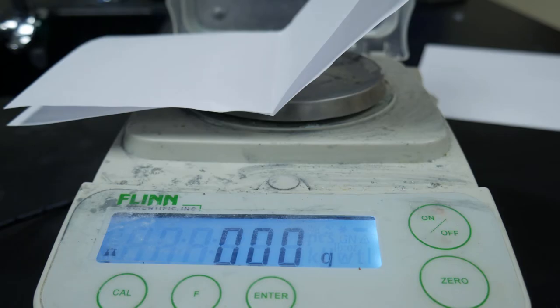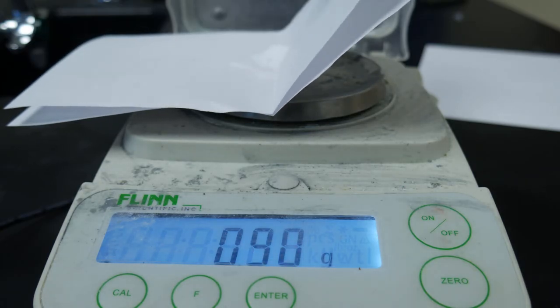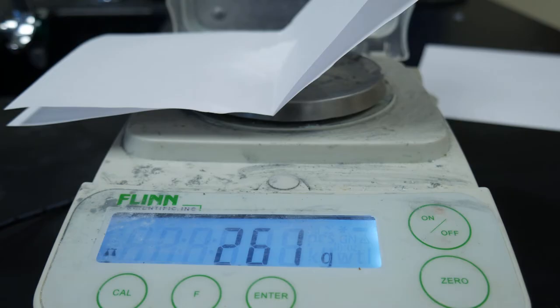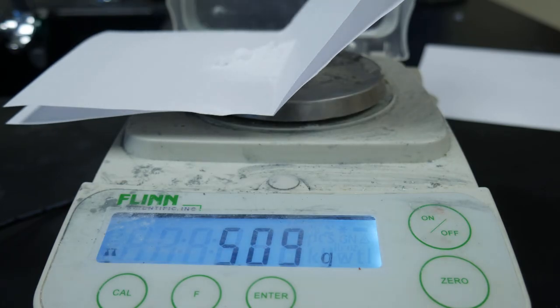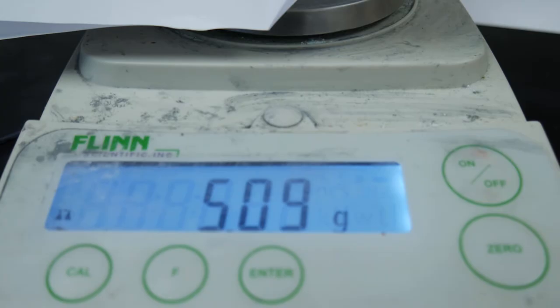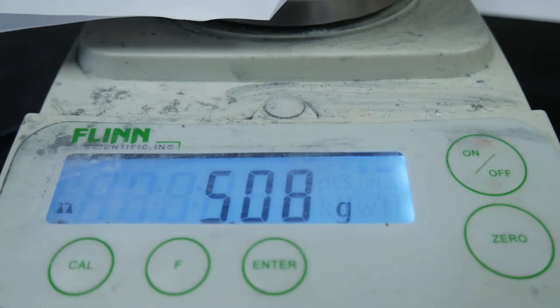We're going to add another five grams of baking soda onto our scale, weigh it along with our flask and vinegar, and also weigh a balloon that we'll put over our flask — getting the total mass of all our reactants before the reaction. The mass of our baking soda for trial number three is about 5.09 grams. Record that on your data table.